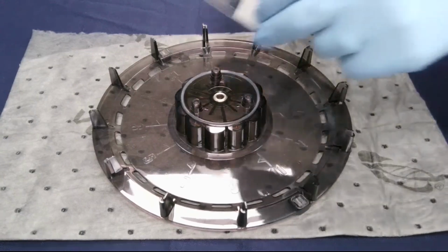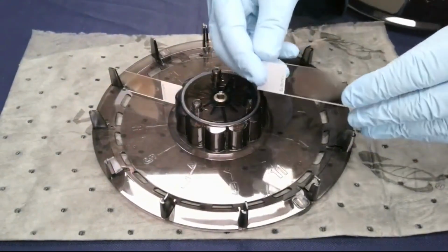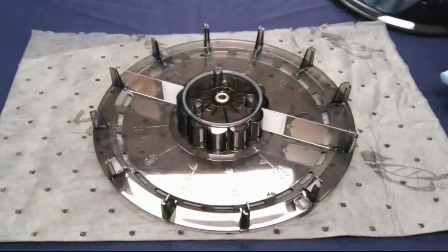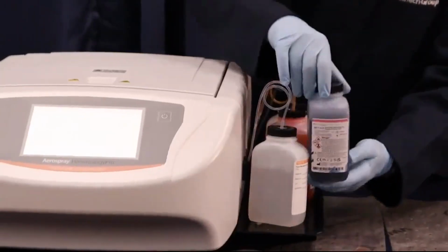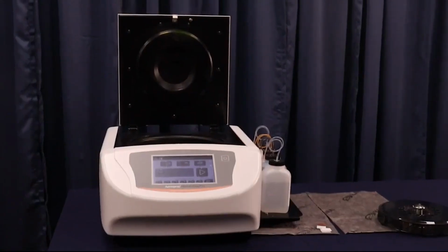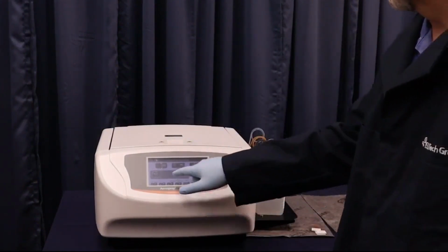We are now going to demonstrate how the ELITech Aerospray Pro instrument works for blood smears. It is critical that the slides are loaded in the carousel correctly, facing clockwise with the frosted edge to the hub and on top of the corresponding number of the slide. Then reattach the top of the carousel. For reagents, the Aerospray Pro uses a buffer, thiazine dye, eosin, and methanol for fixation. To start a run, simply load the carousel into the chamber and close the lid. There are several programs to choose from, but you may also edit your own protocol to your preferences.